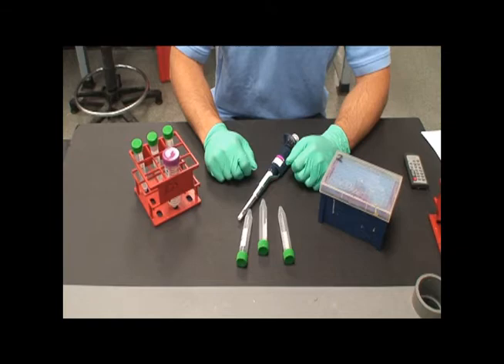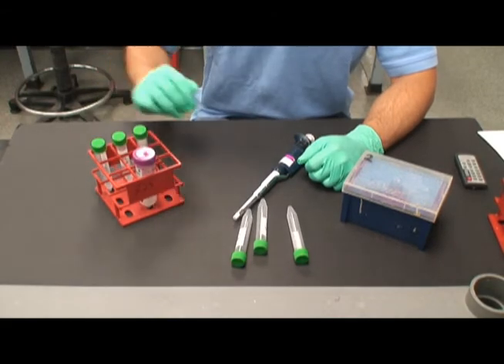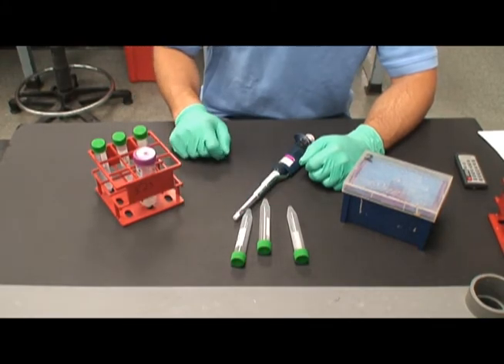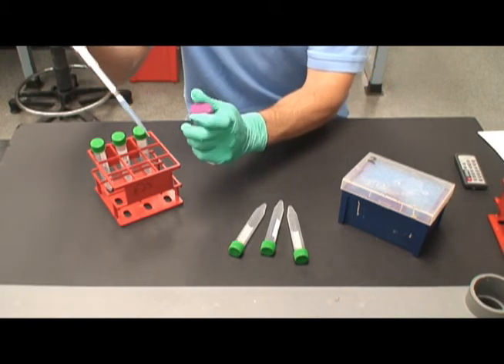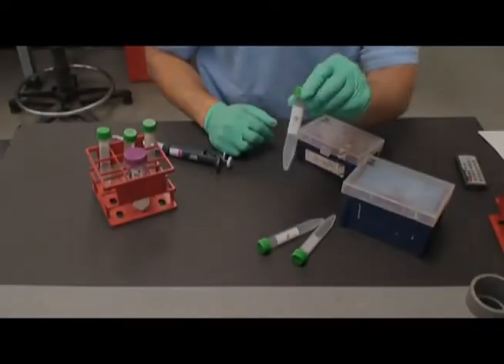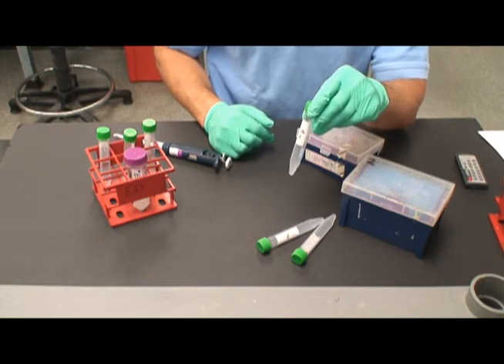On the table are 3 new test tubes labeled minus 6, minus 7, and minus 8. We have here our phage dilutions from the previous step and E. coli. To the test tubes, add 0.3 mils of E. coli and 0.1 mils of the phage dilution. It is very necessary to practice sterile technique and change the pipette tips after each transfer. After the transfer is complete, gently vortex the tubes and set them aside for 15 minutes at room temperature.